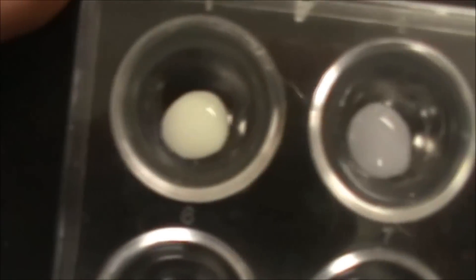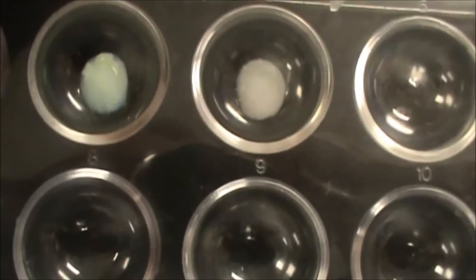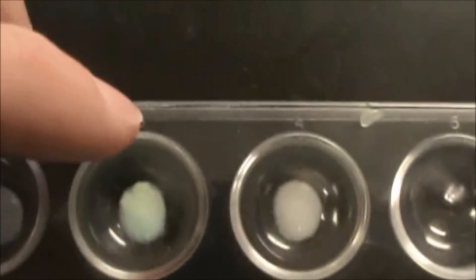So now I've got kind of a cream yellow color. This is kind of a purple-gray color. This is a yellow cream color. And here we still have kind of a whitish color.